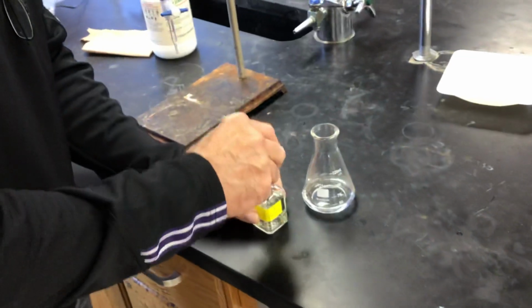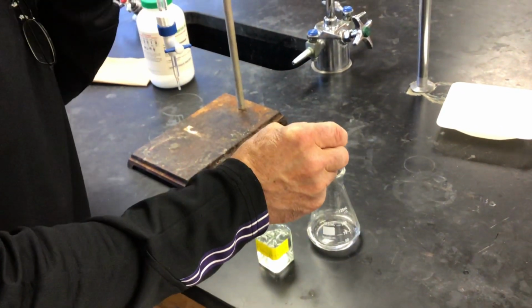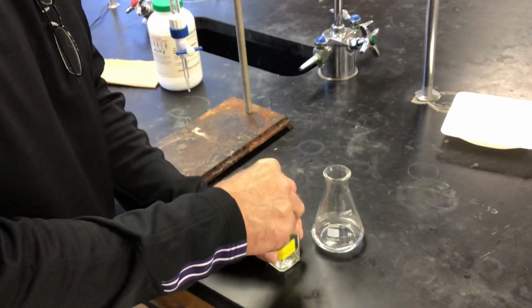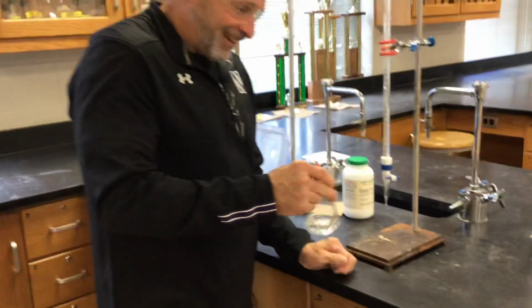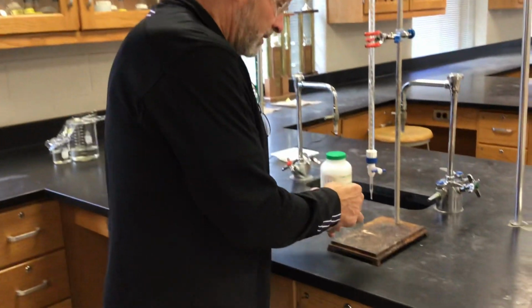All right, so we got the KHP, our acid. Here comes our indicator. Let's not forget the indicator, because if you forget the indicator, then you don't know when you hit the end point. I always tell people use 1 drop, 2 if you're feeling wild and crazy. Okay, now we're going to start to titrate.